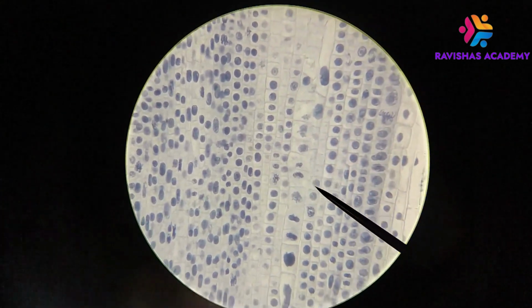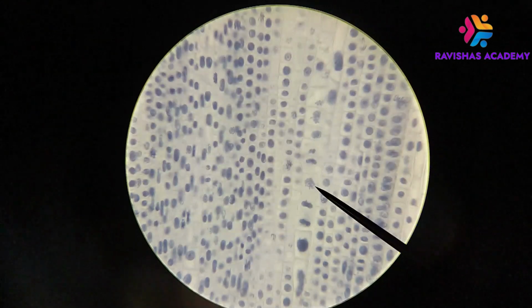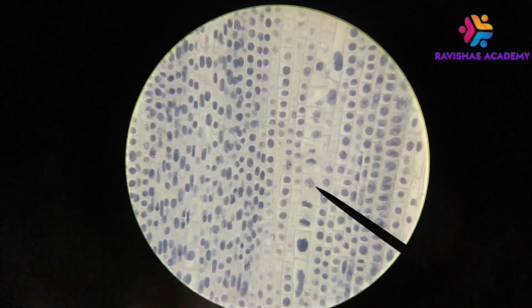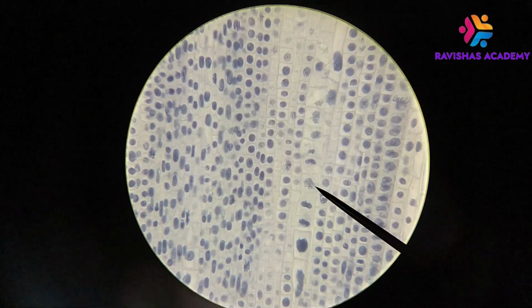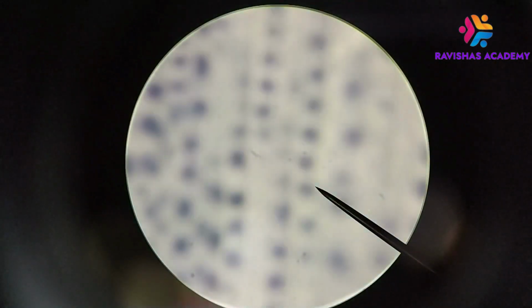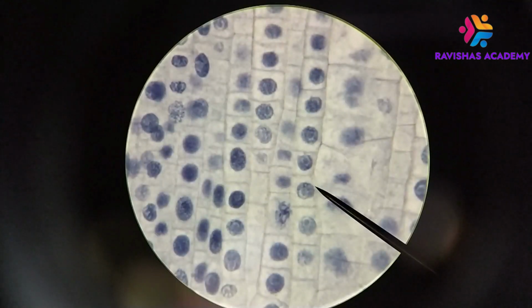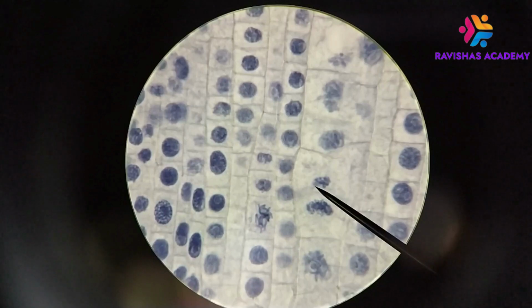Okay, and so what you're seeing, for example, in here is a nucleus that is a little bit more broken apart, and what you're seeing are chromosomes. Okay, so since we're here at 400x, and we're having a really hard time seeing this, let's see if we can zoom in and just go to 1000x total magnification. Let's focus this and take a look at these cells a little bit more closely.